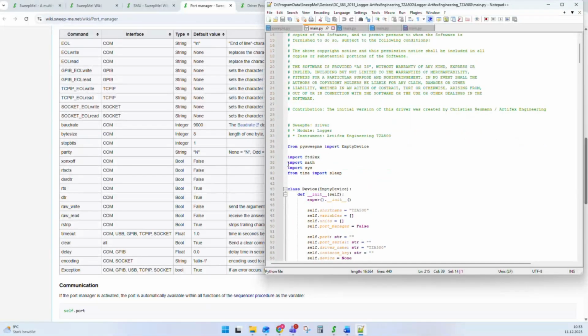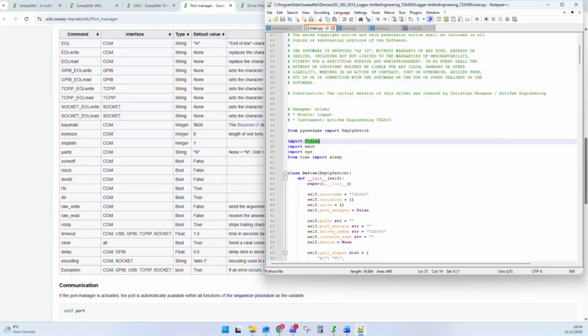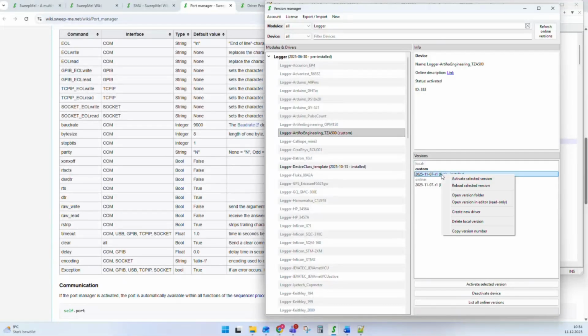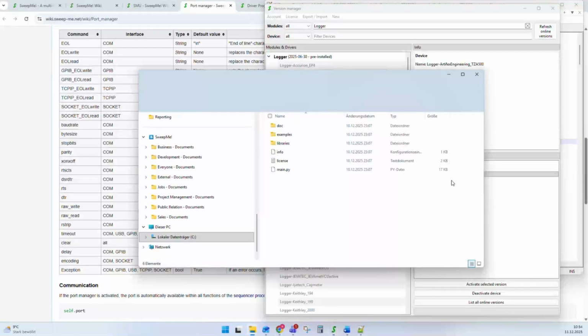And therefore, some drivers sometimes need to ship their own libraries when they need special libraries. And here, for example, this transimpedance logger driver needs this FTD2XX library to come with it to load it. So let's have a look again into this driver to see how this is done. I have to switch to SweepMe, to the version manager. I go to this driver, I will open the version from the server in a new folder.